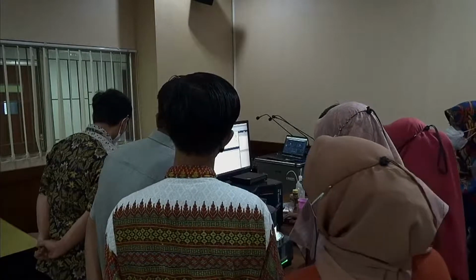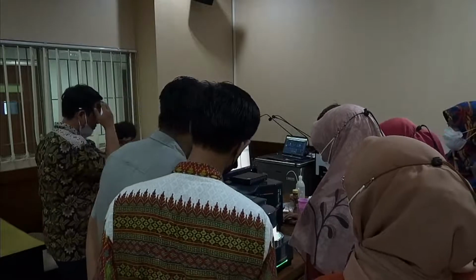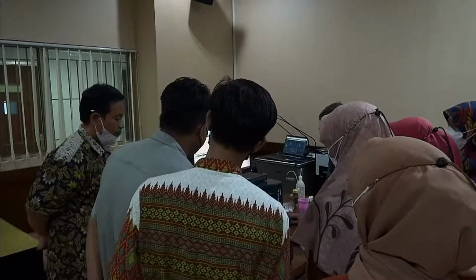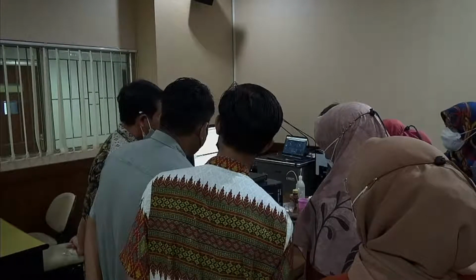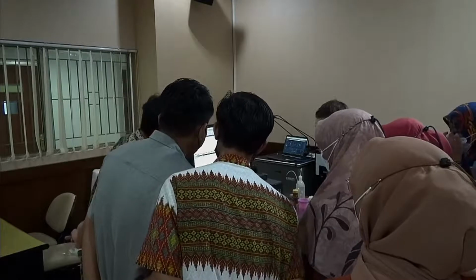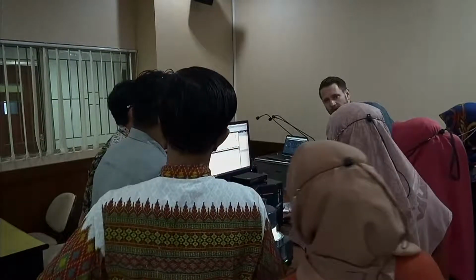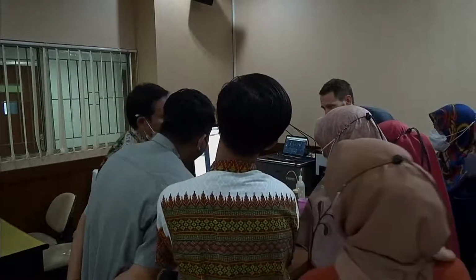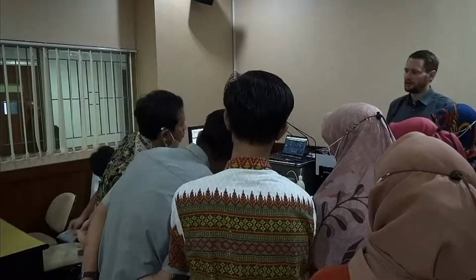Once you have your results in, what you can quickly do is go to the print button and select any kind of report which you find appropriate. You can also edit these reports in the software to make it the way you want it, but this would be a standard one, so it's directly a PDF which you can save, and you have all the information which you need on that page.